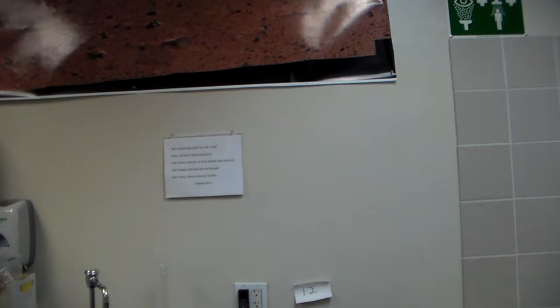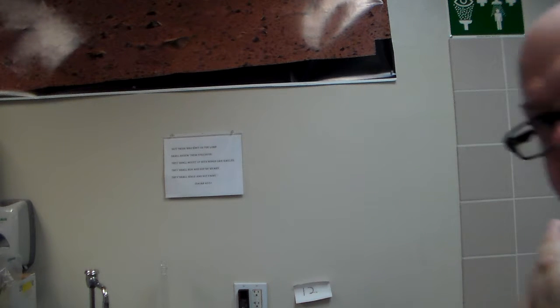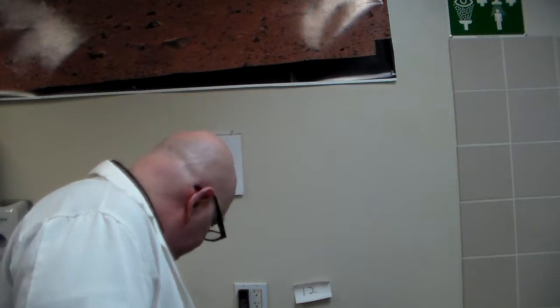Oh, dropper, dropper, wherefore art thou, oh, dropper? The one time in my life I need a dropper, I'm in the lab, and I can't find one. Wow, that really stinks. That's okay, I will get one, never fear, I'll be right back. As we go get the dropper is what we need. Oh la la, the dropper's what we need. Hey, with the dropper. Okay, now we can go do something with it. So, I'm back. And no, I wasn't planning on making a singing career.